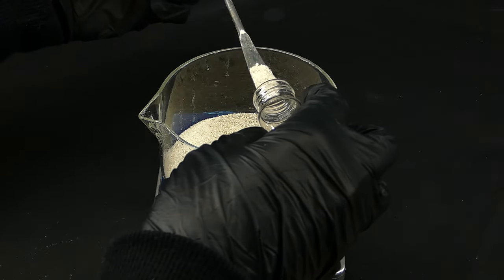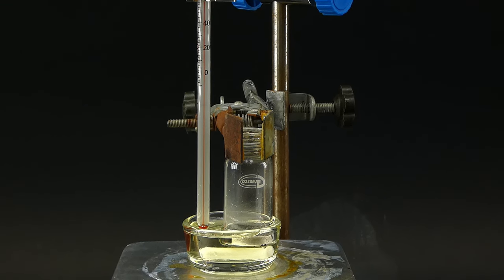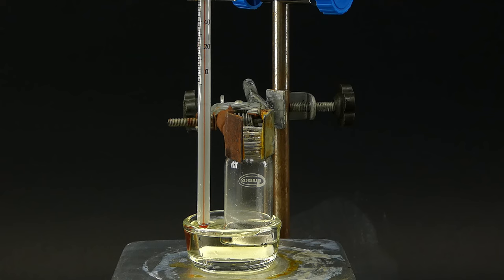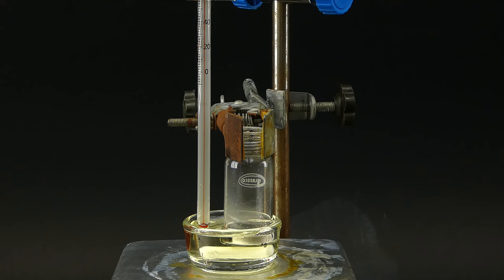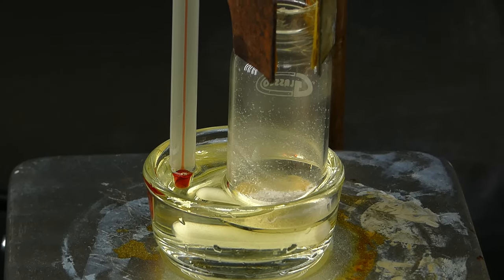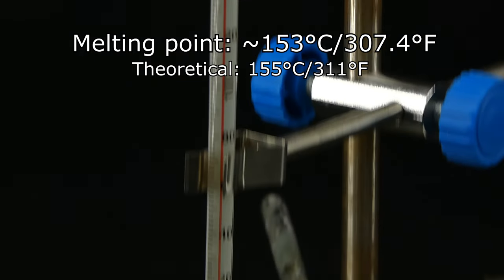I got 0.5 grams of the product into a vial for analysis and set the sample up for a crude melting point test. This molecule is supposed to melt at 155 degrees Celsius, so I had to use an oil bath. It confirmed that the thing I made is indeed the diketone and not just some random crystallized tar.